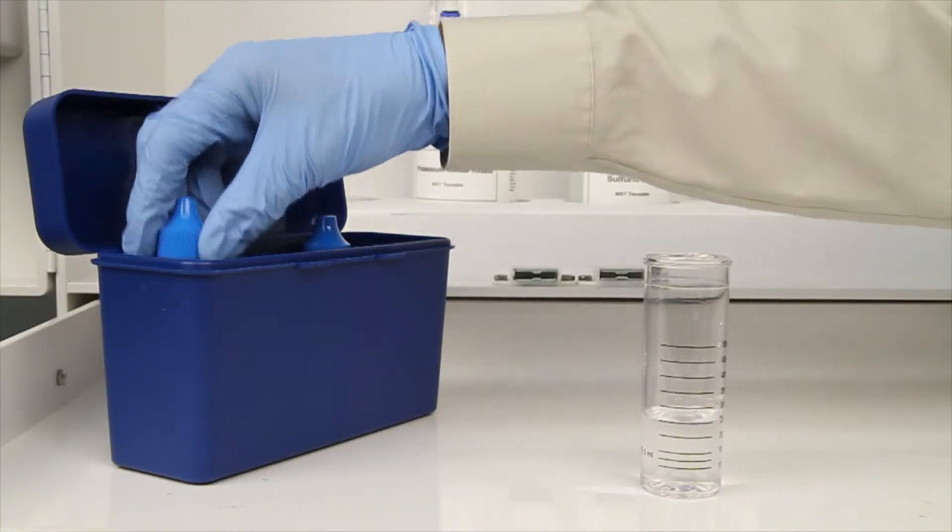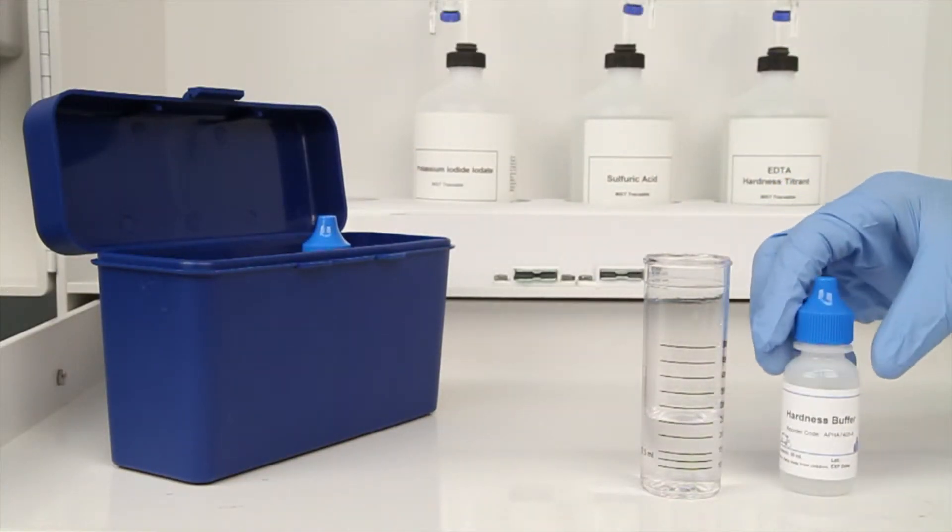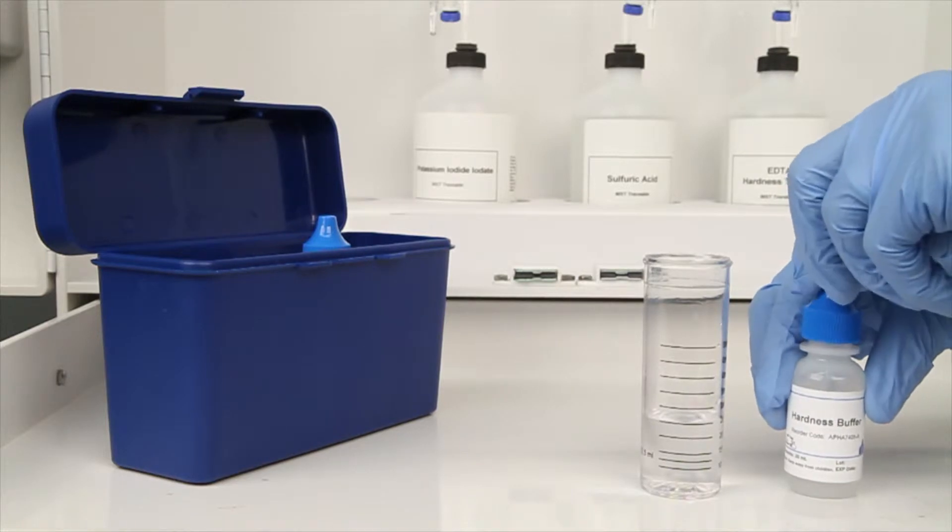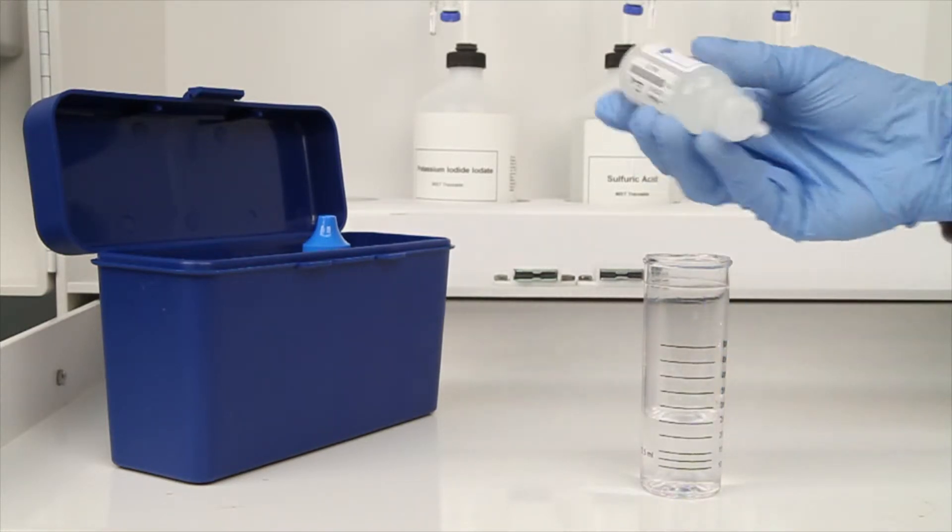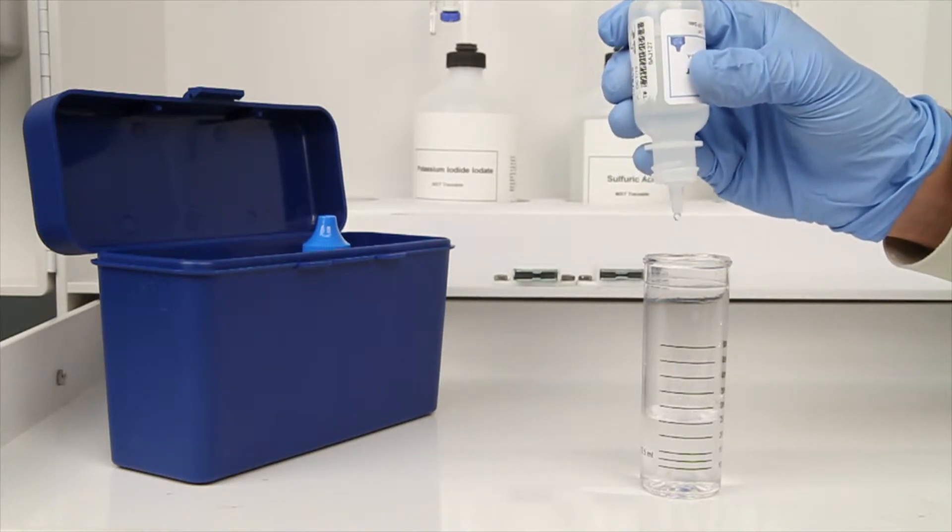The next step according to the Endpoint ID procedure is to add five drops of calcium hardness buffer. Be sure to hold the bottle vertically to get a consistent drop size.